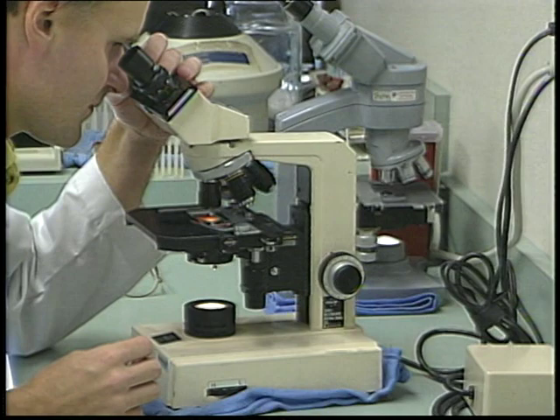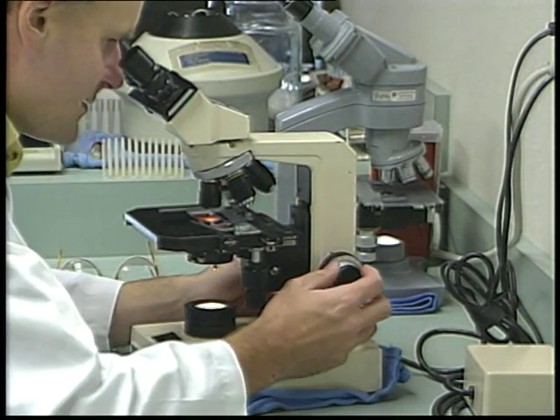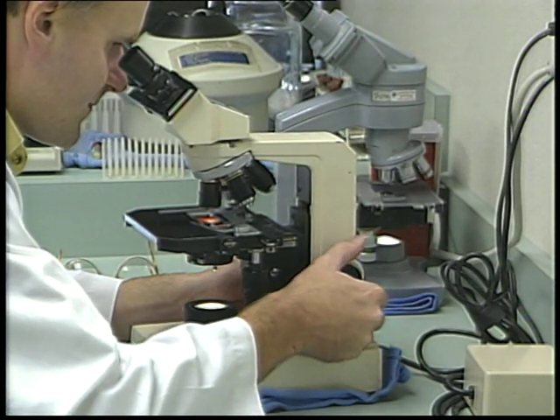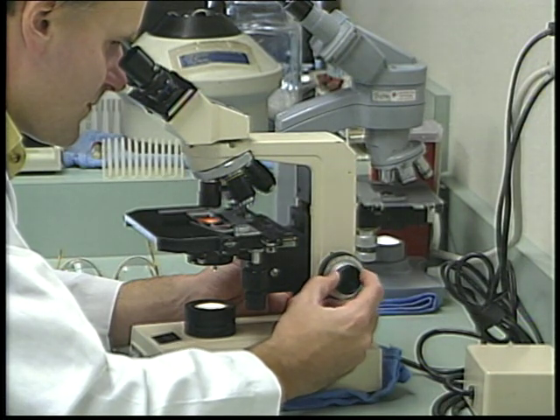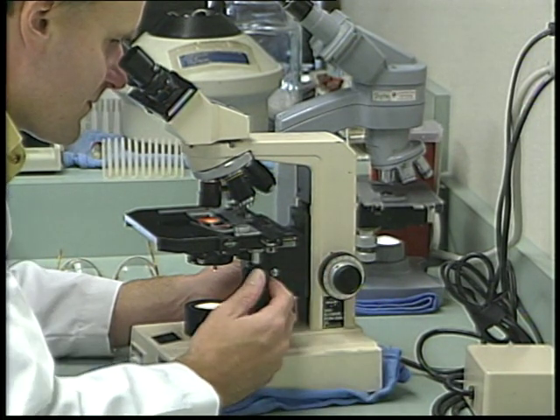Once the slide and 10x objective are in place, you are now ready to find the correct focal distance. There are 2 focus knobs on a microscope, a major focus and a minor focus. Start with the objective close to the slide and slowly increase the focal distance using the major focus knob.